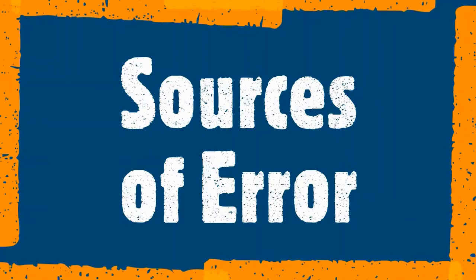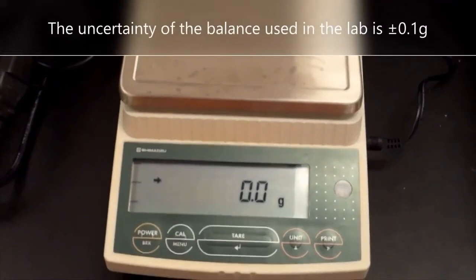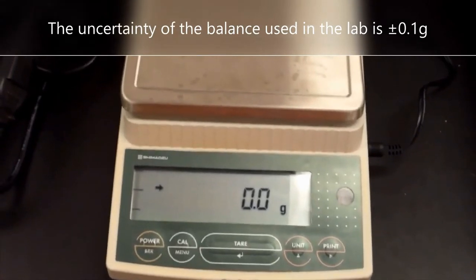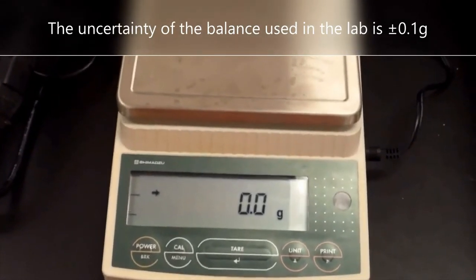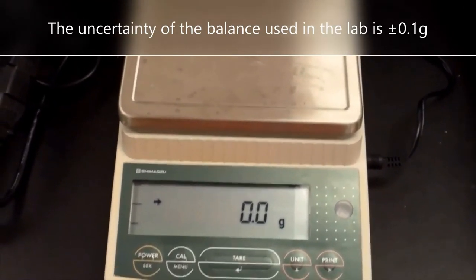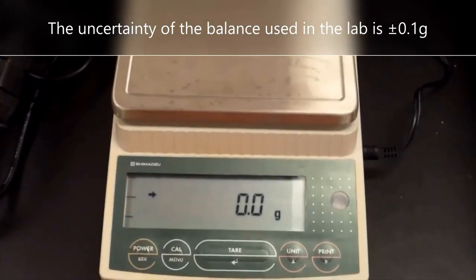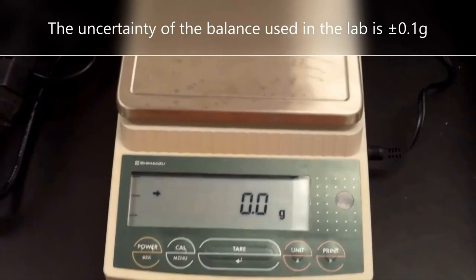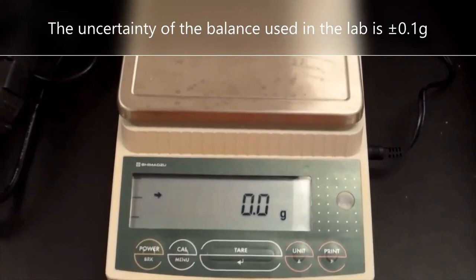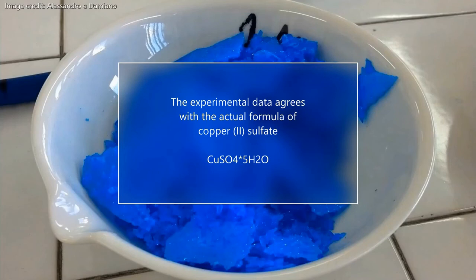The experimental result is slightly off because the electronic balance used has an uncertainty of plus or minus 0.1 grams. The result is well within the range predicted given this level of uncertainty. If we ran the calculation using 1.45 grams of water instead of 1.5, and 2.65 grams rather than 2.6 for the anhydrous copper sulfate, the ratio would be 1 to 4.8, meaning the difference can be fully accounted for by the uncertainty in the mass measurements.